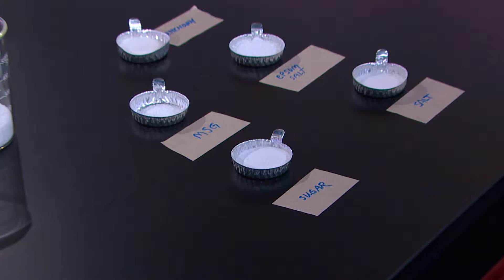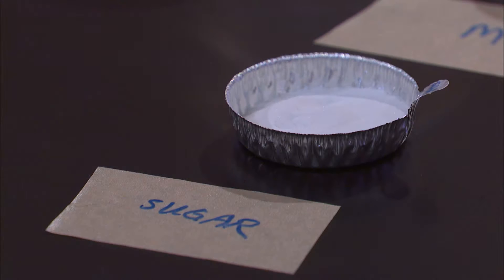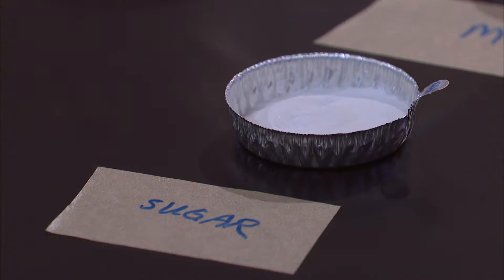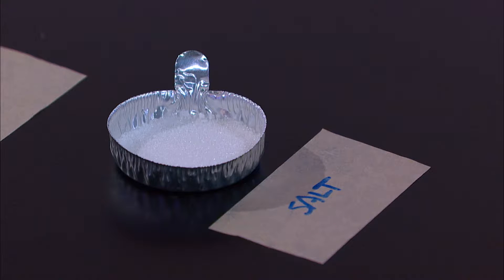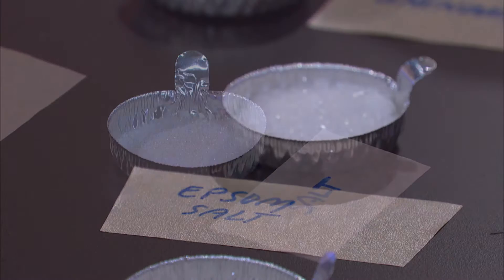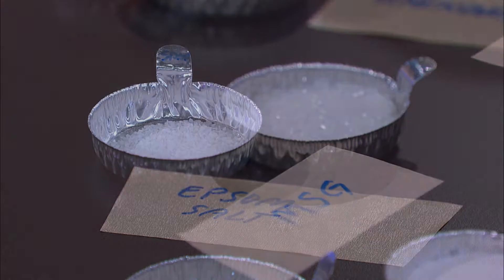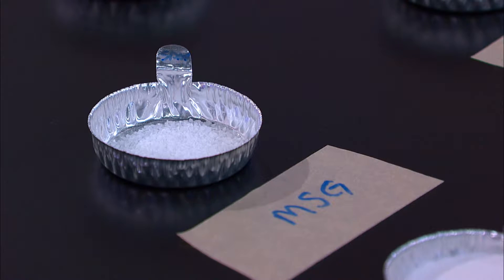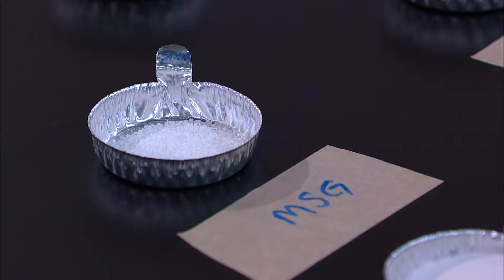Here are the four known chemicals: table sugar, known as sucrose; table salt, known as sodium chloride; Epsom salt, known as magnesium sulfate; and monosodium glutamate, or MSG, used in certain food recipes.